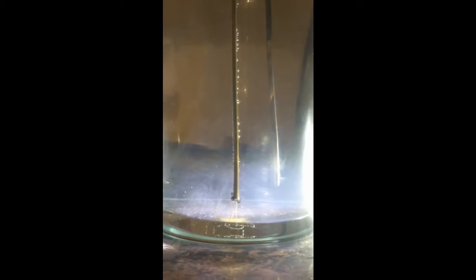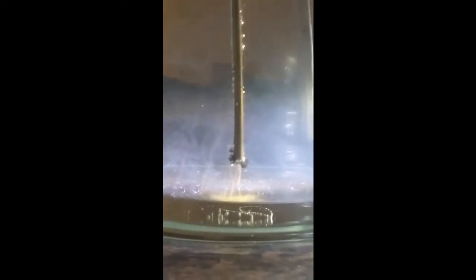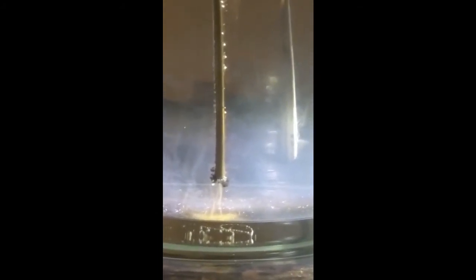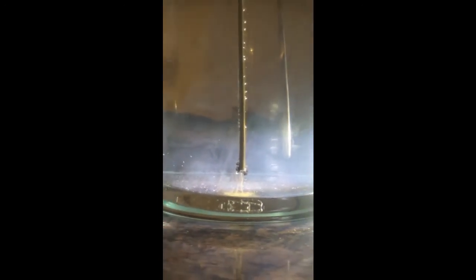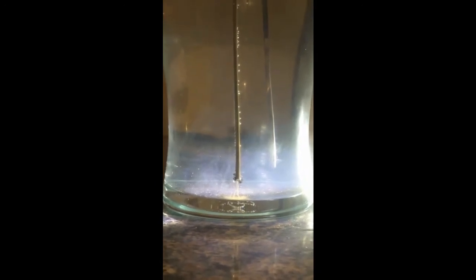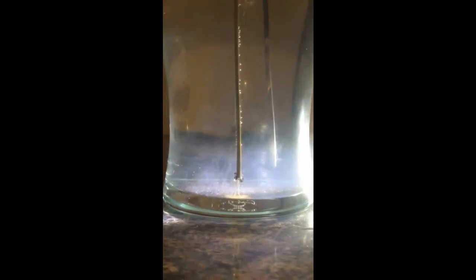It can be filtered out using filter paper, but that's a pain which you don't really want to do unless you have to. So my other concern is that this brown stuff that you can see coming off the rod here at the bottom, you can't get out of the water. Basically, that will end up in the solution and there is no way of getting it out, and it can't be very good for your health.